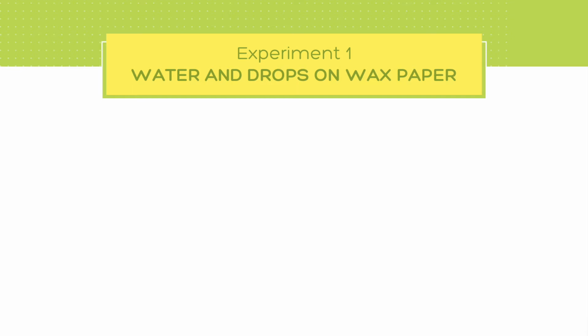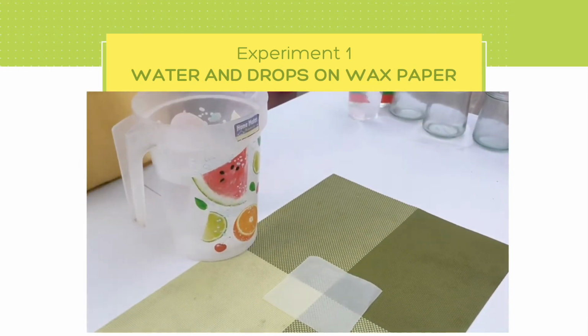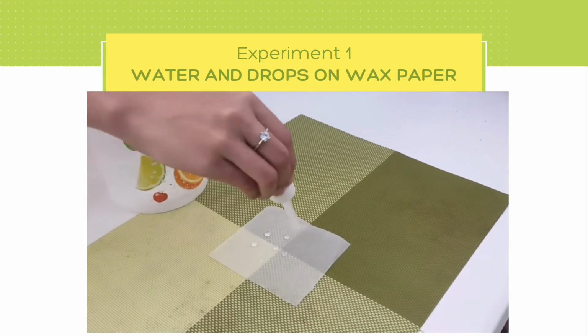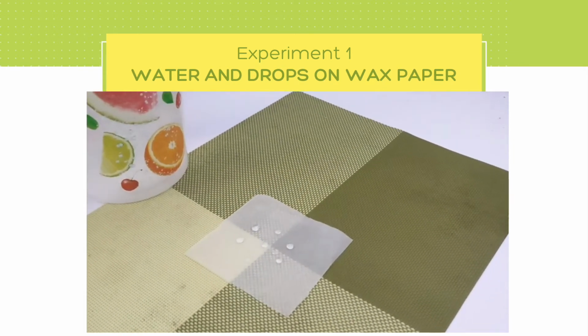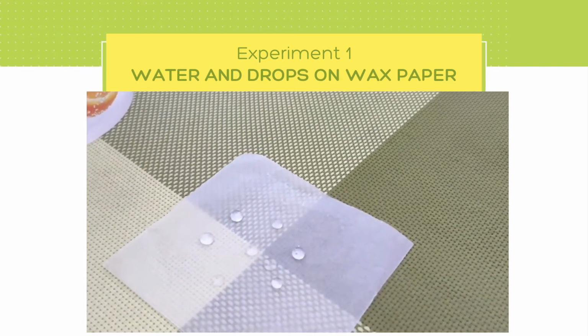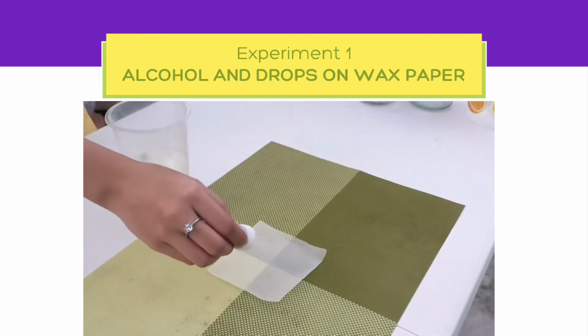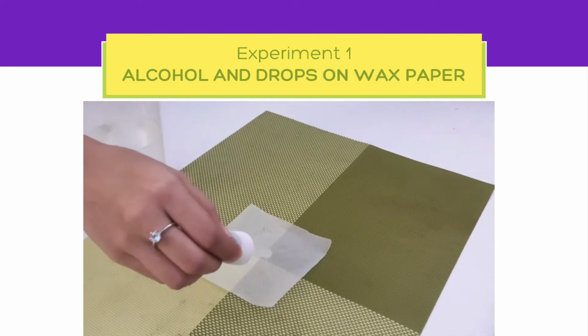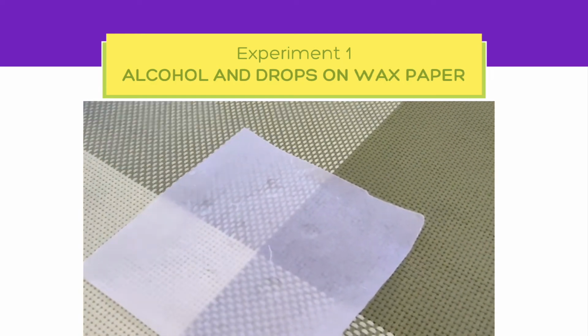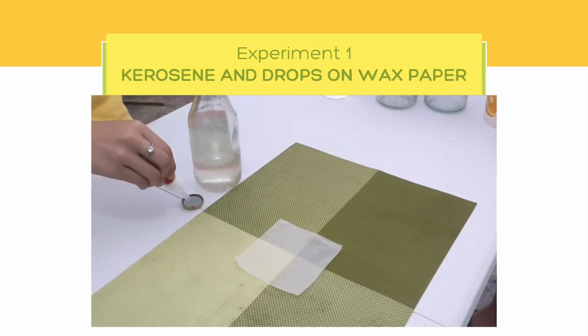Experiment 1. Water and drops on wax paper. Alcohol and drops on wax paper. Kerosene and drops on wax paper.